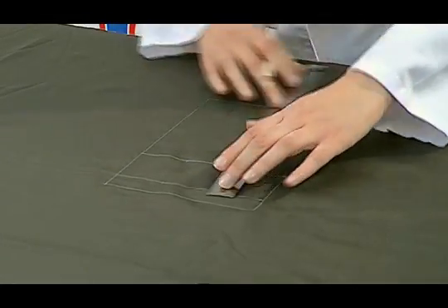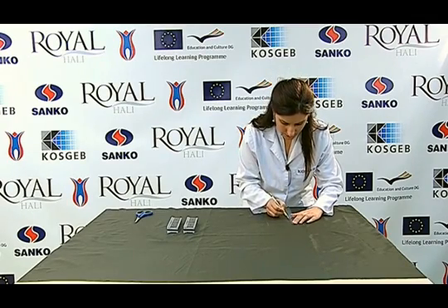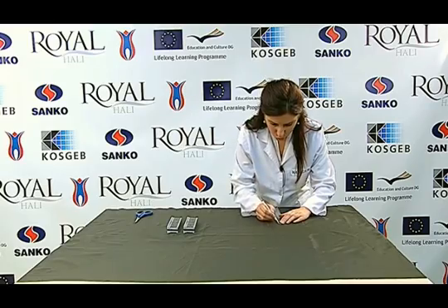Then, 100 mm lines are drawn just below the sections we have marked as 20 mm to the selvage and a tongue-like shape is formed.